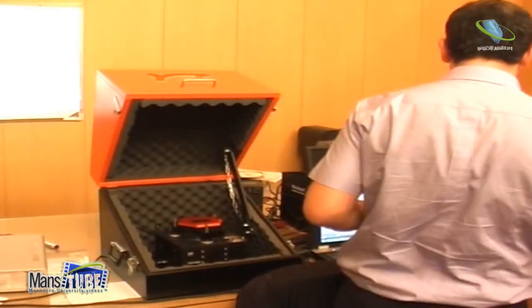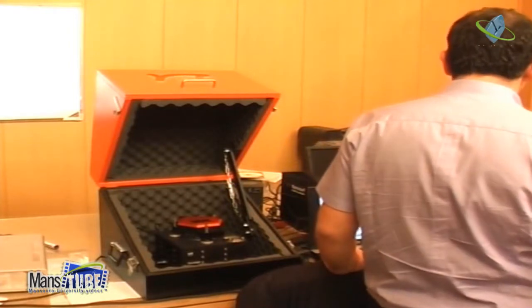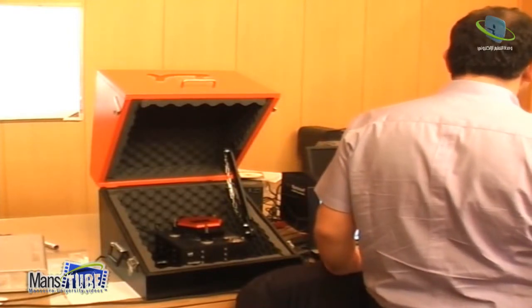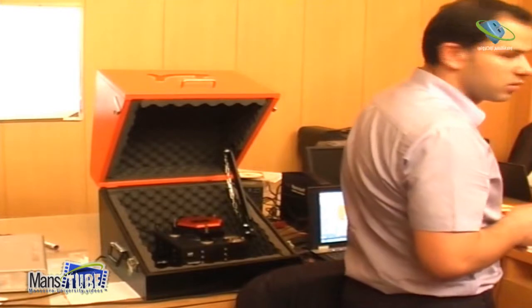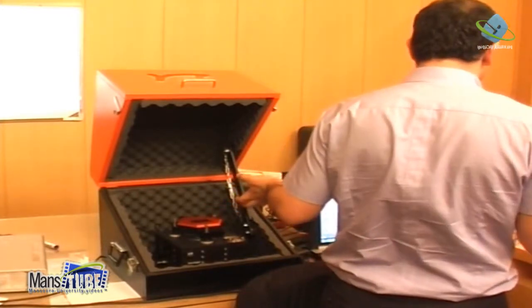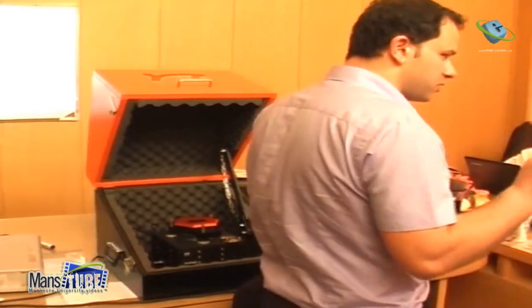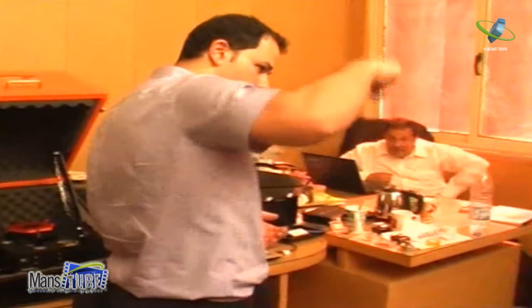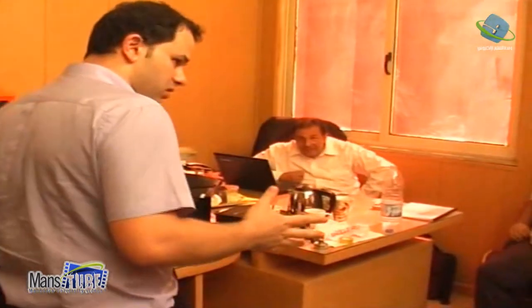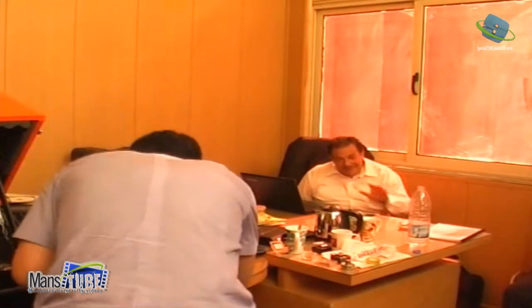How much time is left for liquid only? 5-10 minutes, yeah, maximum. Now I just want to make the approach and start scanning. This is a slight difference you will see, but just in the frequency, and that's all. Okay? Yeah, it's okay, no problem. This is okay. It's not a problem, okay?